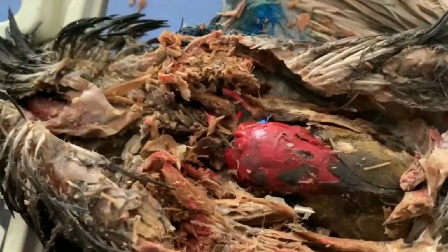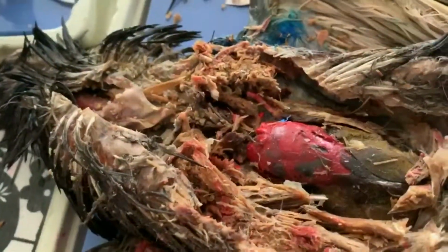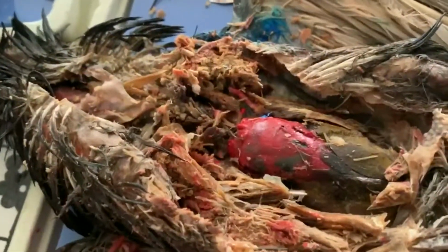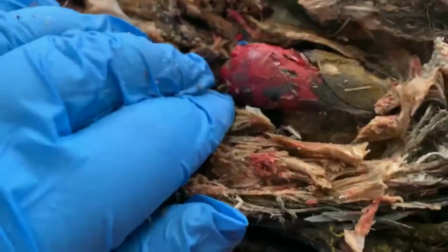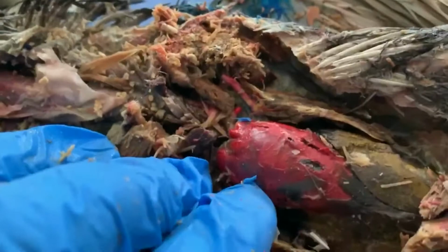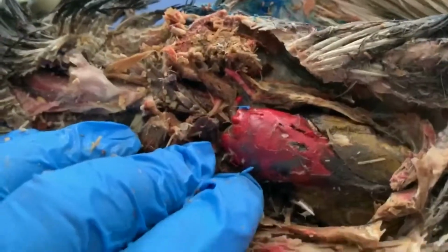All right, so again, Eric gets a phenomenal bird because he already had a phenomenal frog. Eric's bird was super muscular, so we kind of had to manhandle it to get into the chest cavity. But one thing that's beautiful about Eric's bird is that the dye really got isolated well with the heart. So you can see here that the heart is bright red. You can see the blue of the veins there. So just, again, a beautiful specimen of a dyed heart for Eric.